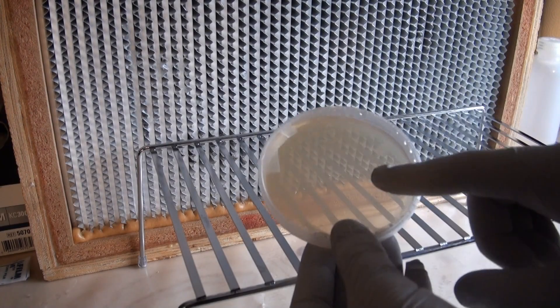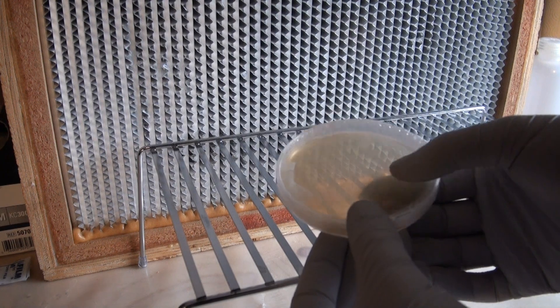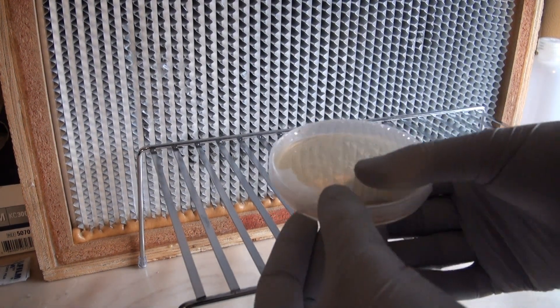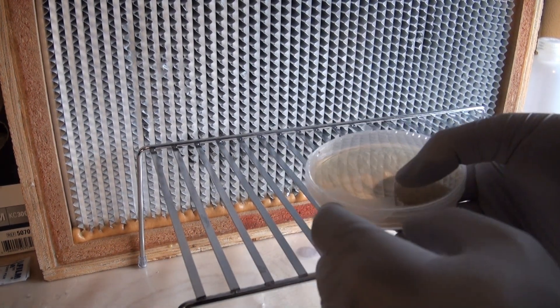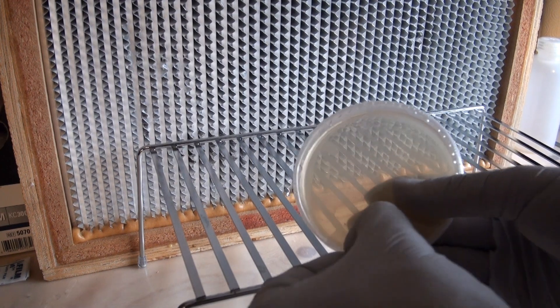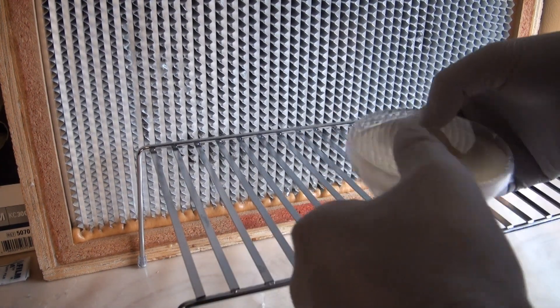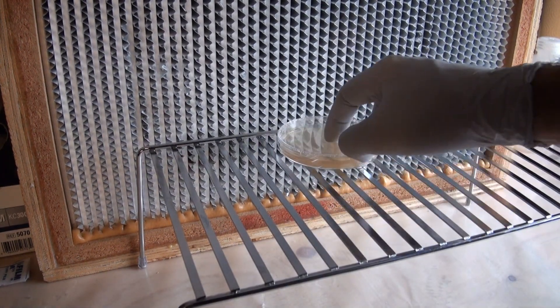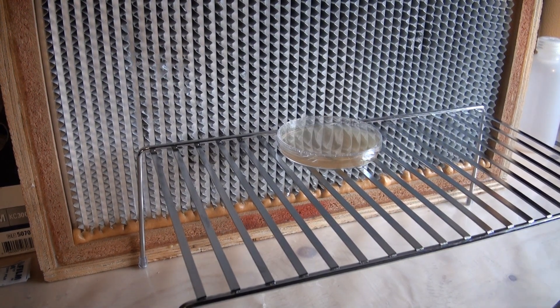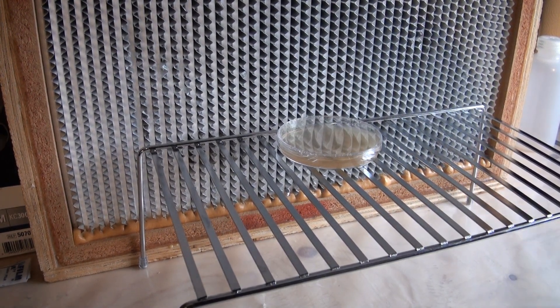First I'm going to get my agar plate ready and waiting for the mushroom culture, just so I'm not fumbling around once you have the mushroom torn open. So this is a plate that I just made yesterday, which is why there's some condensation around it still, but I'm going to go ahead and remove the parafilm and just set that plate right there and it can sit there and stay in the clean stream of the laminar flow hood.